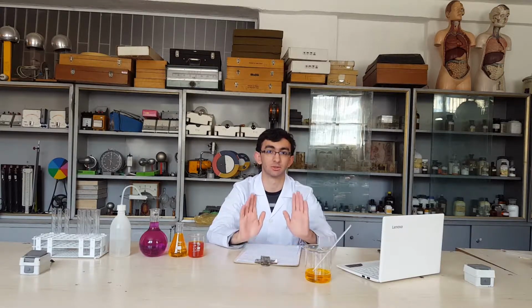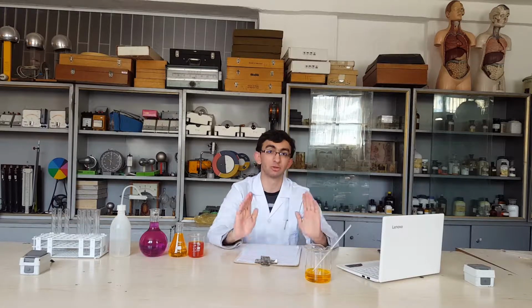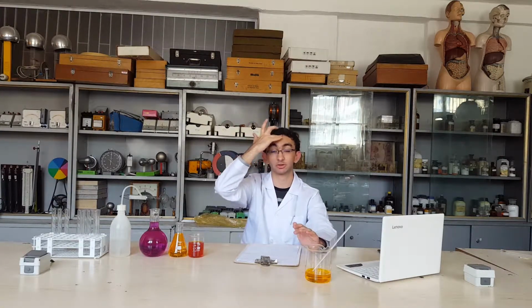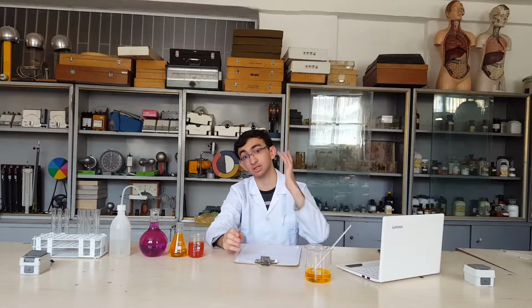But first things first, don't do this alone. You must have a supervisor. Don't put too much sodium in acids unless you want to turn your chemistry station into an airplane. So let's get into it.